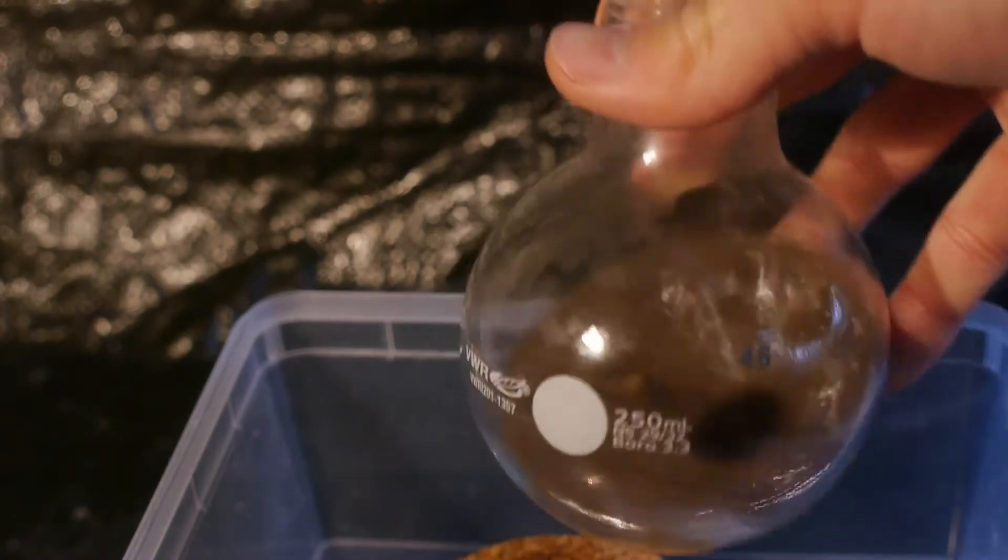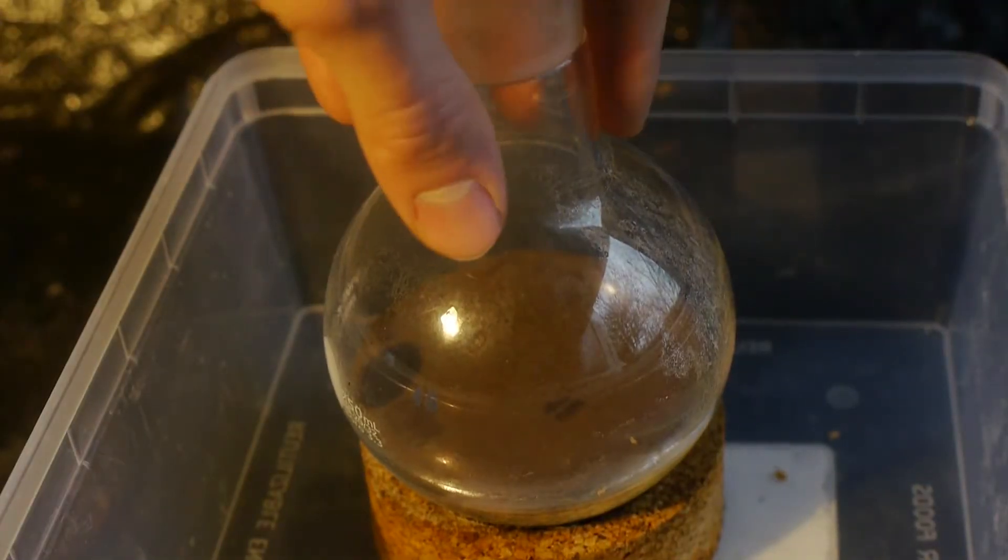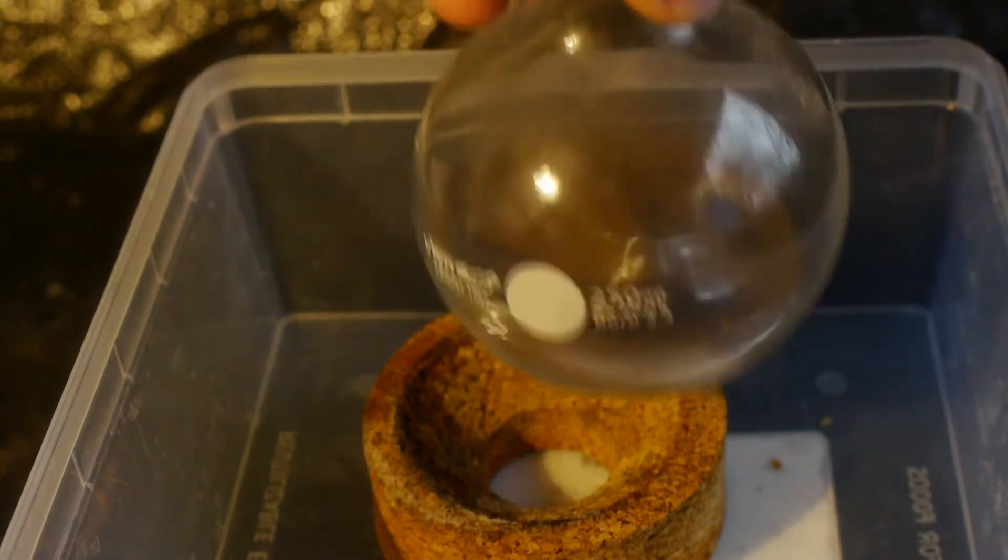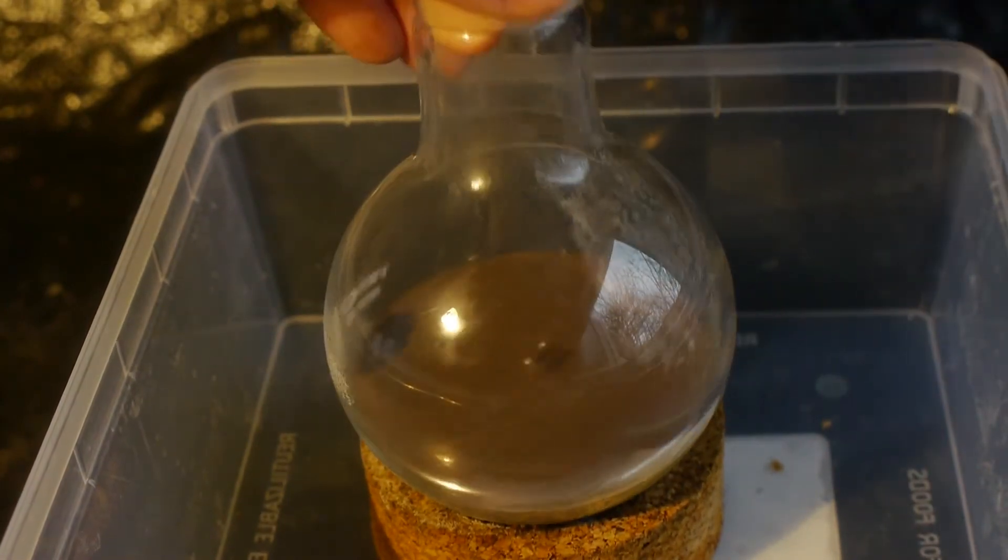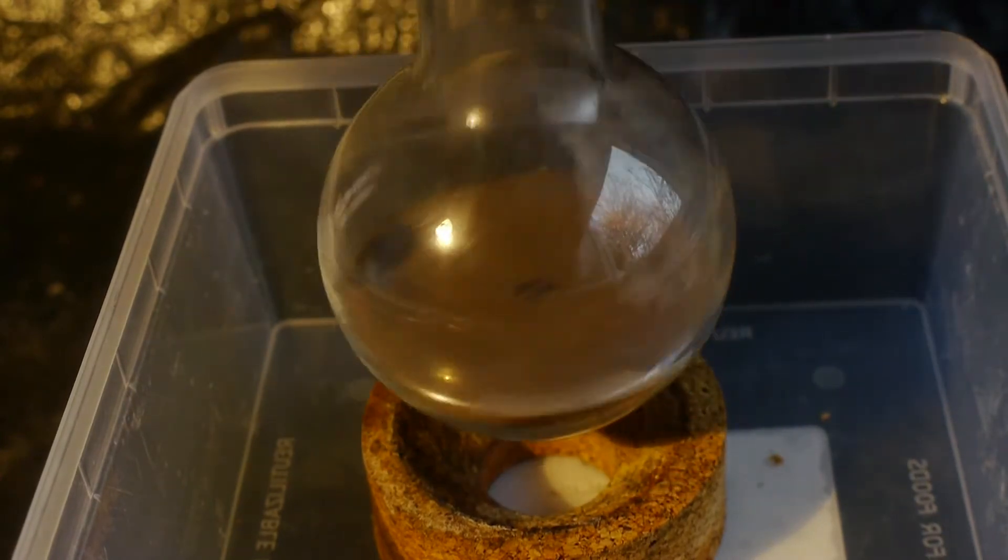Mercury is a quite fascinating substance, I have to say. In order to get rid of the bulk of the mercury we are going to have to distill it. The mercury vapors are pretty much all we have to worry about.